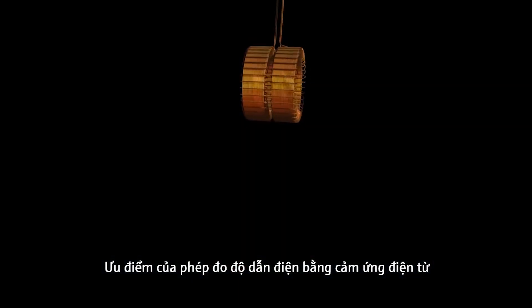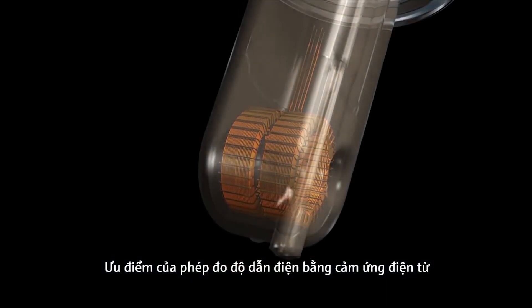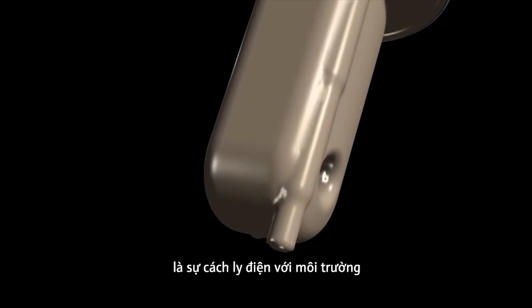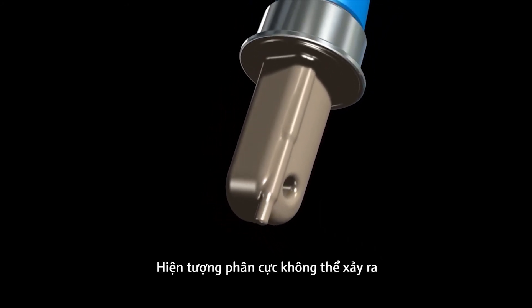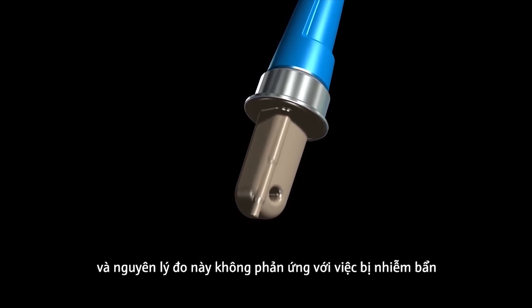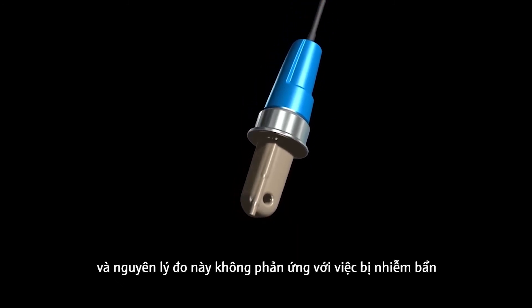The advantage of inductive conductivity measurement is the galvanic isolation from the medium. Polarization effects cannot occur, and the measuring principle is insensitive to soiling.